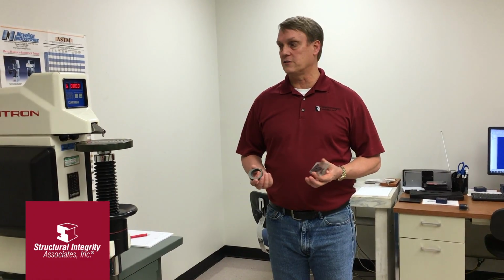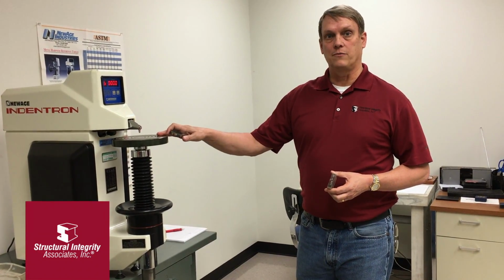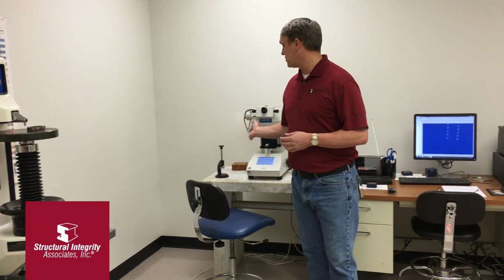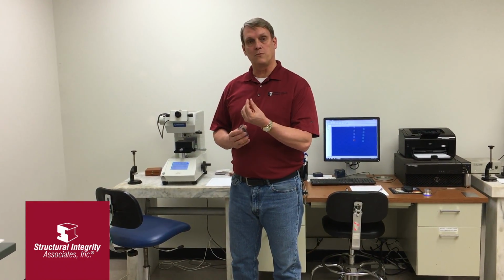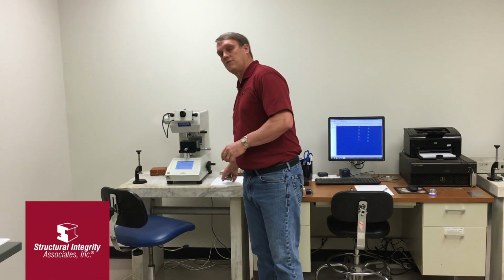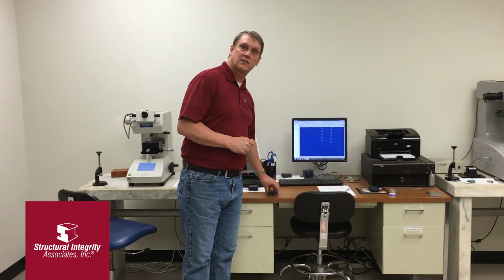Hardness testing is a very simple but effective tool in failure analysis. In the hardness testing room, we have a benchtop Rockwell hardness tester, which is great for bulk samples. We also have a Vickers microhardness testing machine, so that if we're doing hardness measurements in a really small cross section, either like a thin wall tube or in an area that's case hardened around the surface of the sample, the Vickers machine is very nice for pinpointing small indentations and taking readings that way.